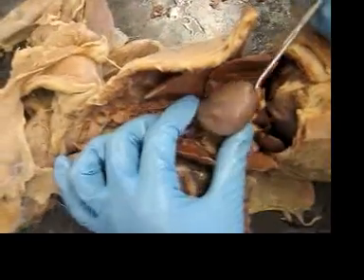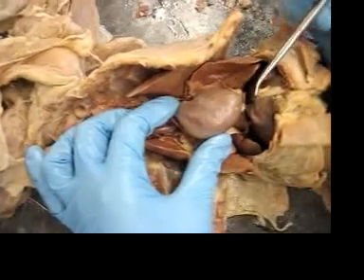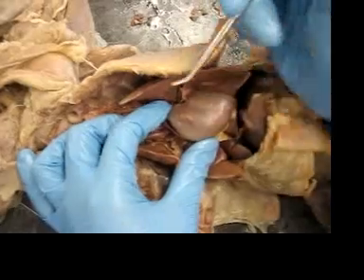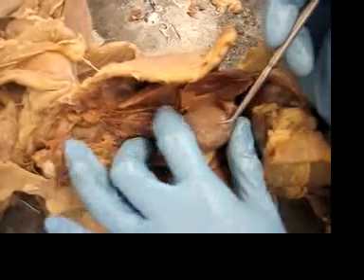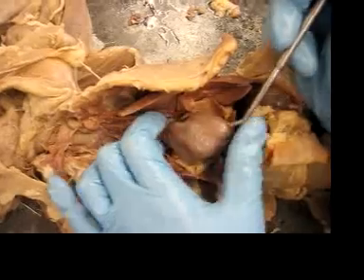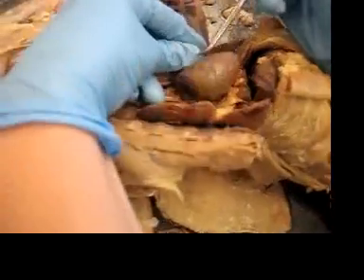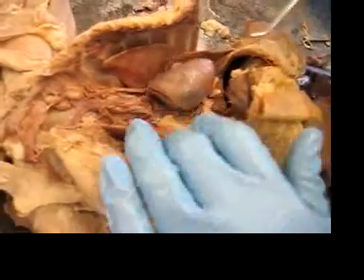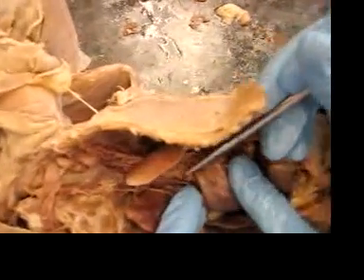This is all the heart. For the parts of the heart: here is the right ventricle, the left ventricle, left atrium, and right atrium. The aortic arch is under here.